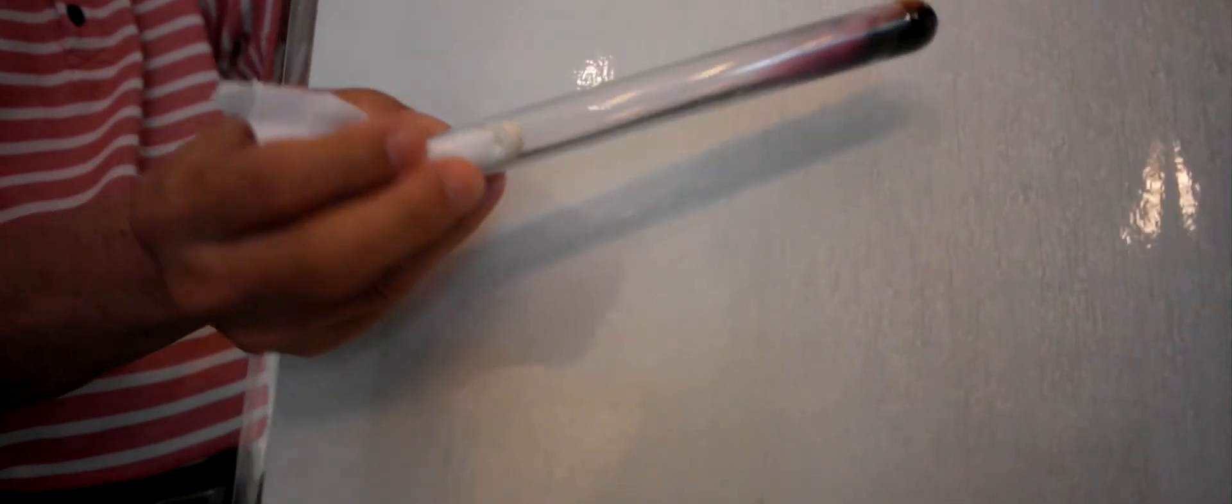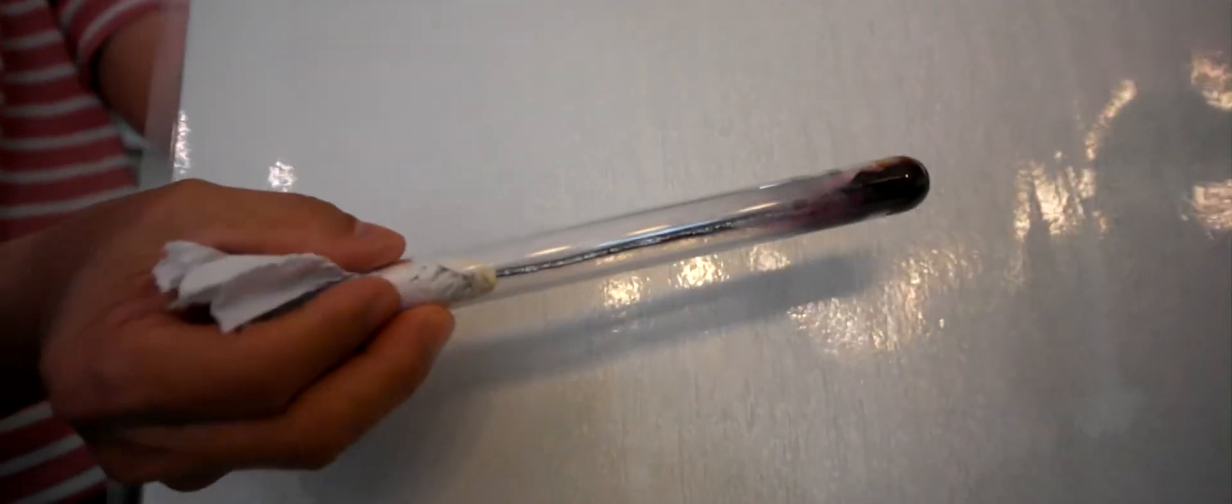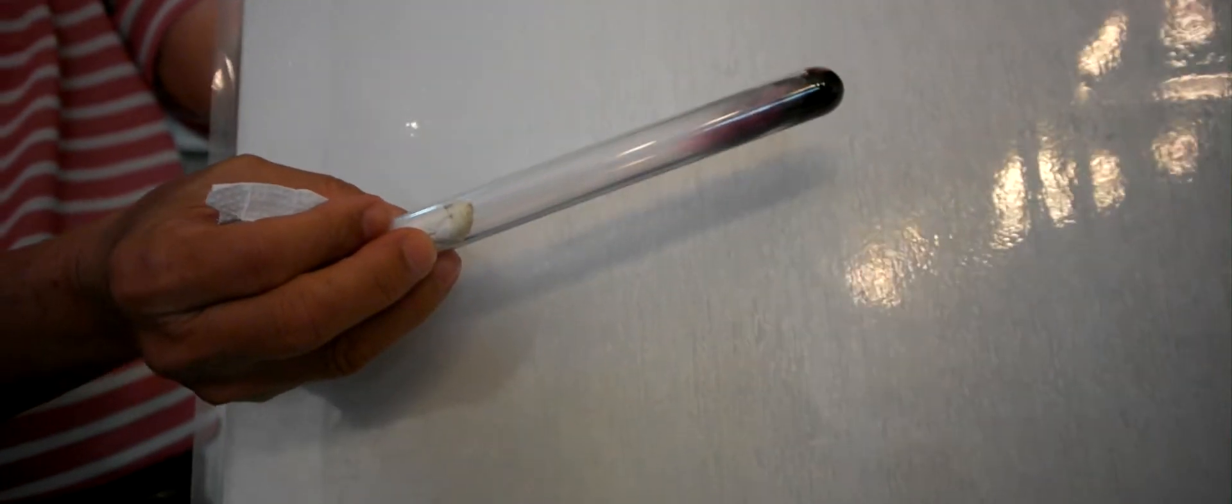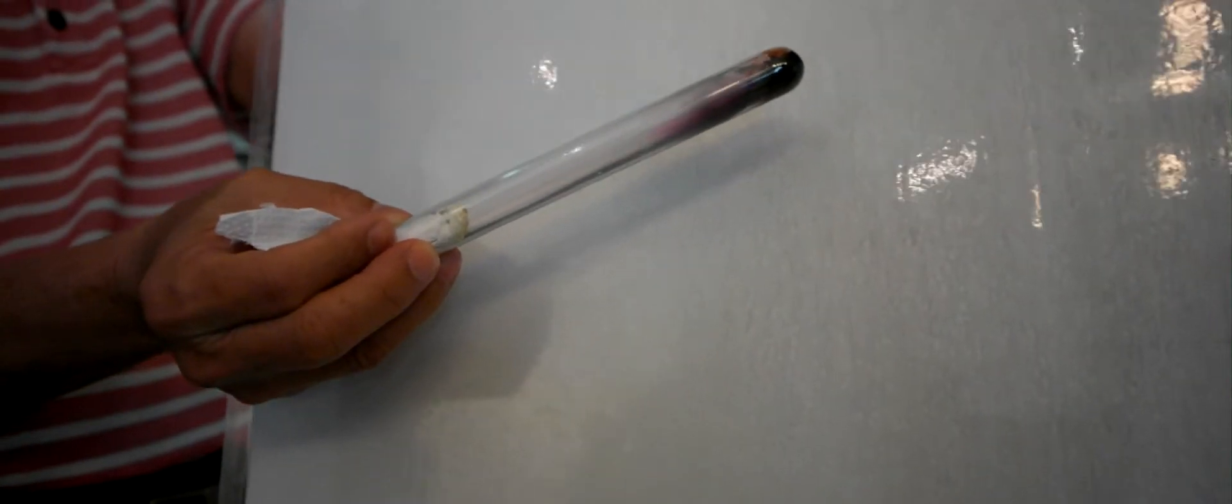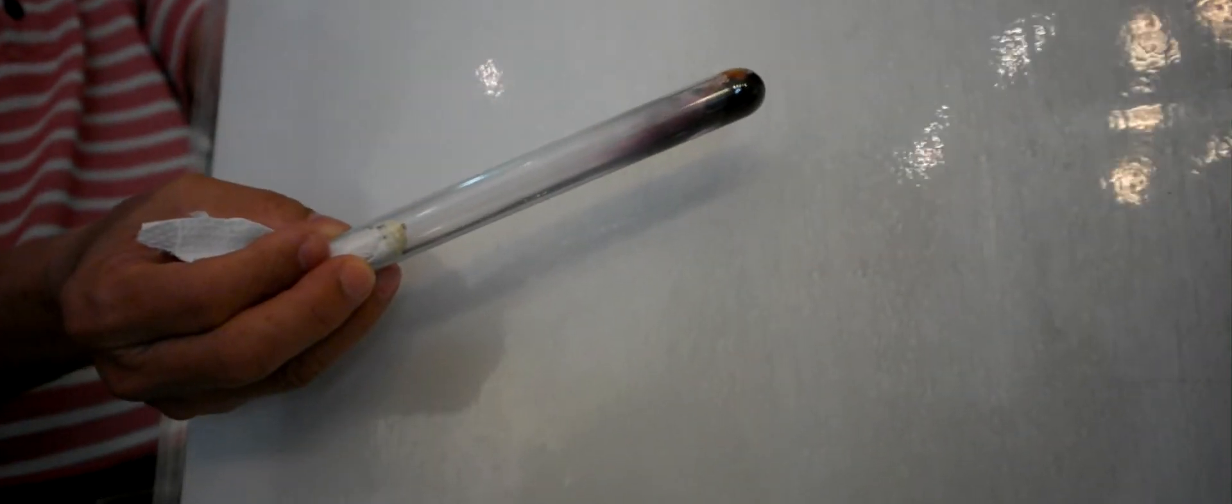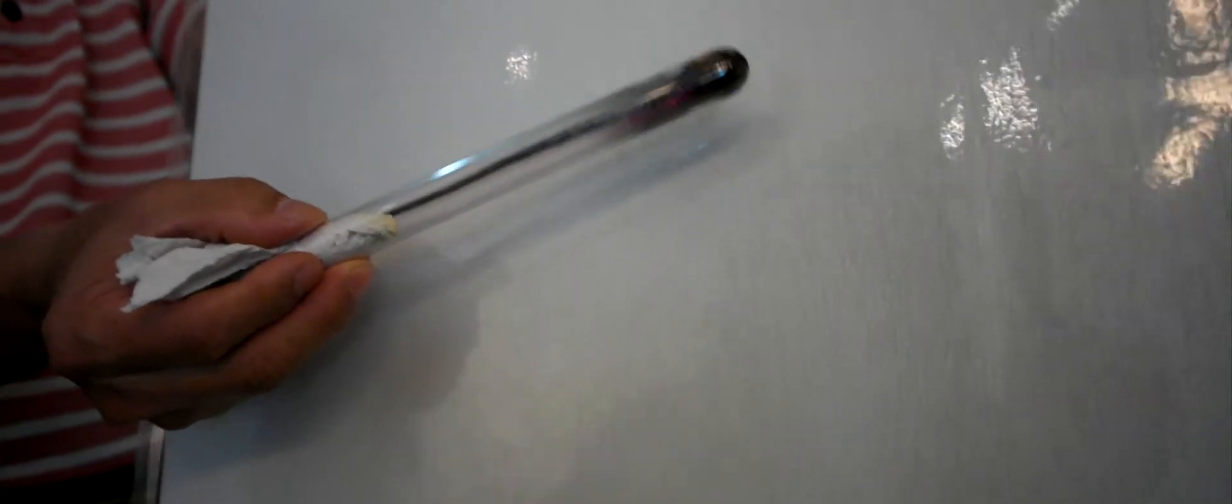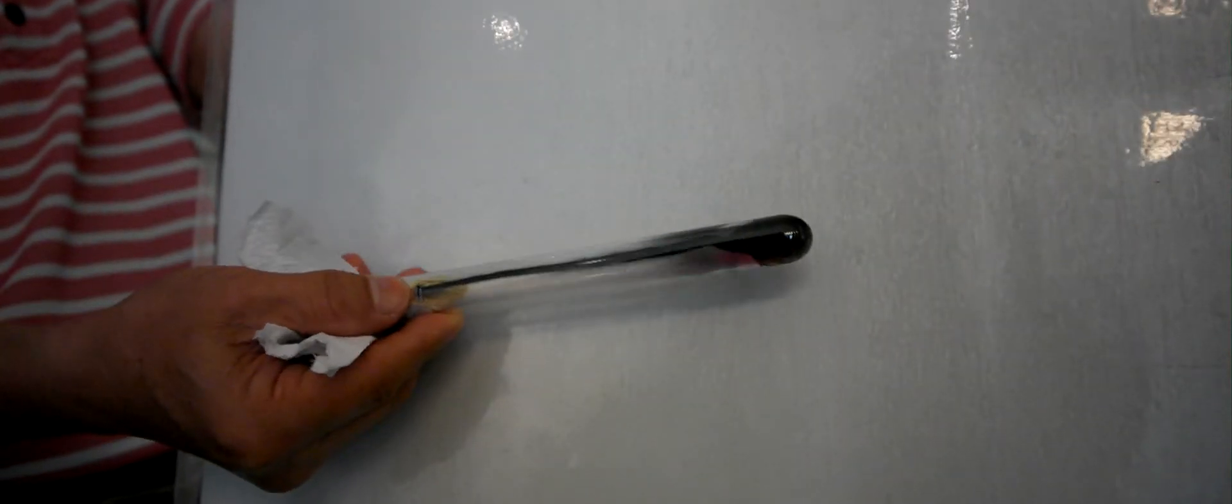Like that. Can you see that iodine has flowed down the tube? Now this is re-solidified liquid iodine. Can you see? It is re-solidified liquid iodine.